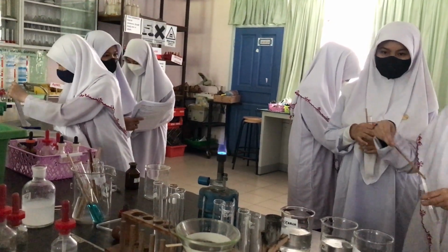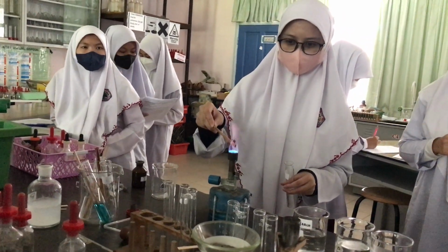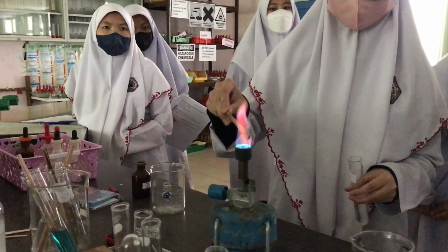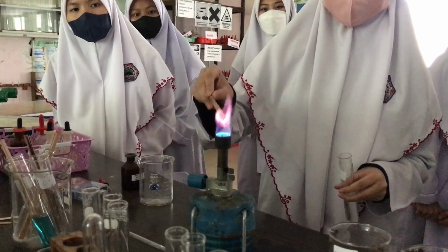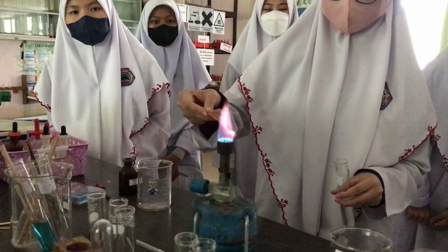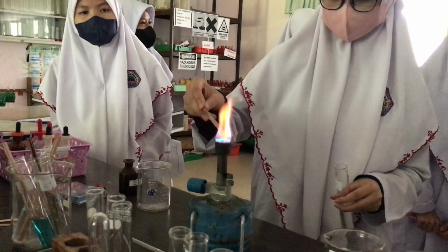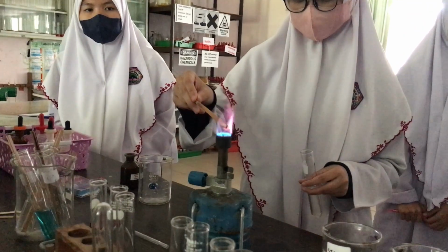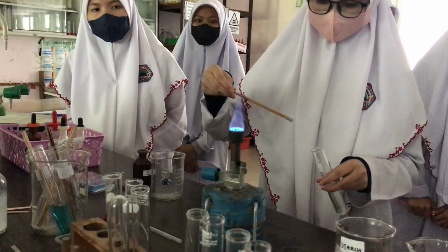Last one. K plus, yeah? What do you notice? Come closer. This one is quite hard to see, yeah? It's okay. Just keep on going. You see the slightly different color? So just now was kind of blue, right? Now it's kind of violet. It's not a violet red. Lilac. We don't call it purple, yeah? Purple is really dark purple. This one is more lilac, yeah? I think it's starting to burn already. You might need to immerse it again. Starting to burn already. Okay?